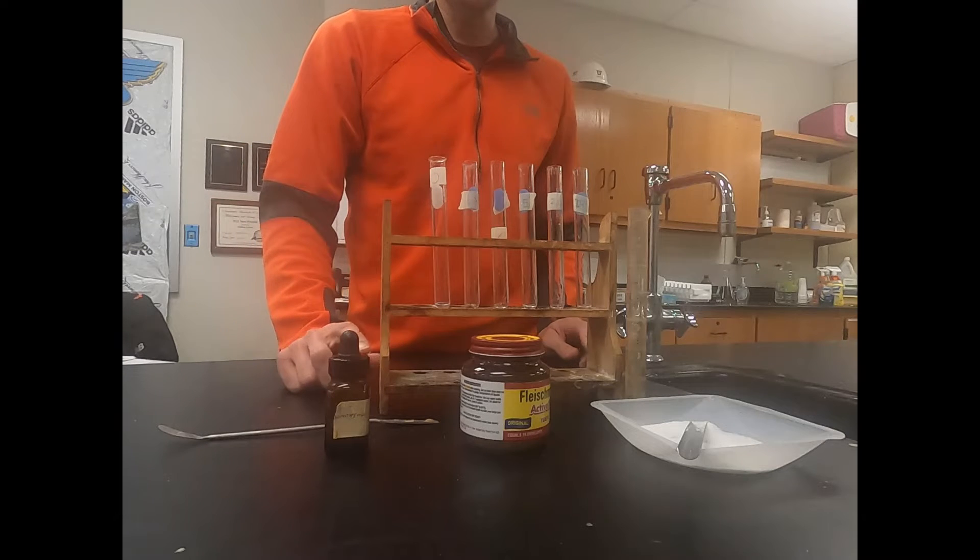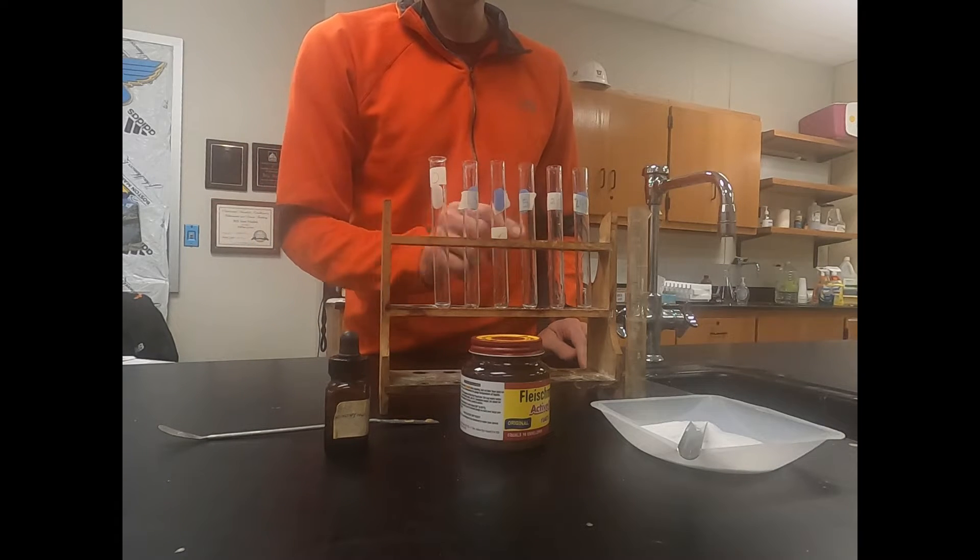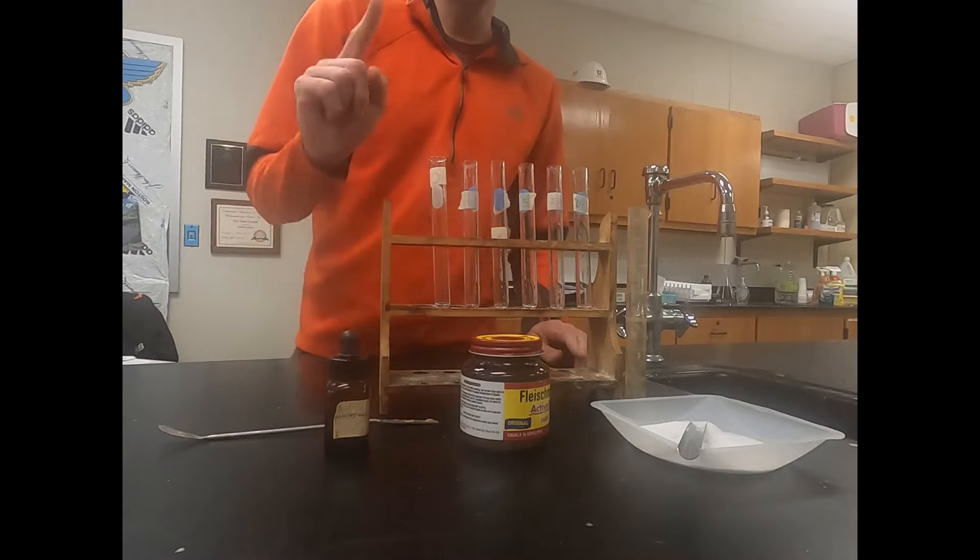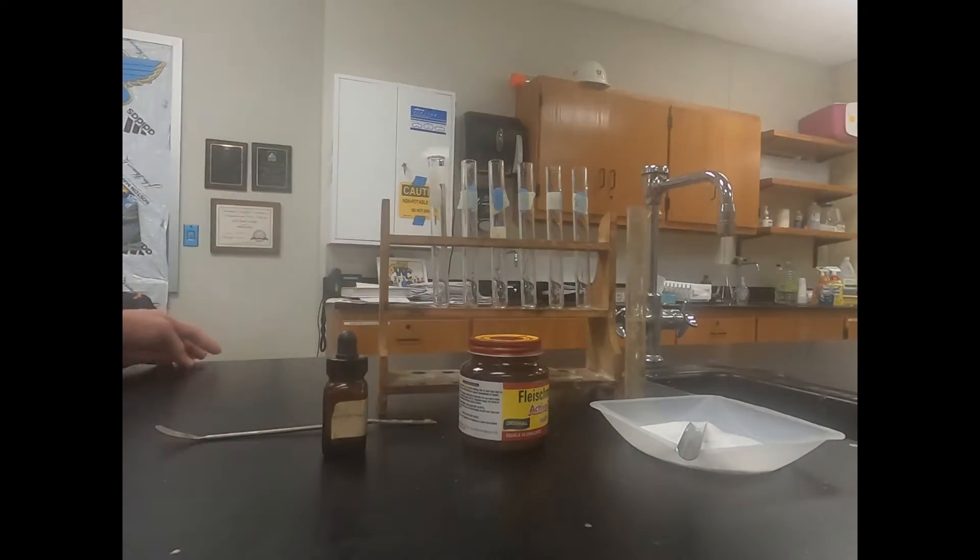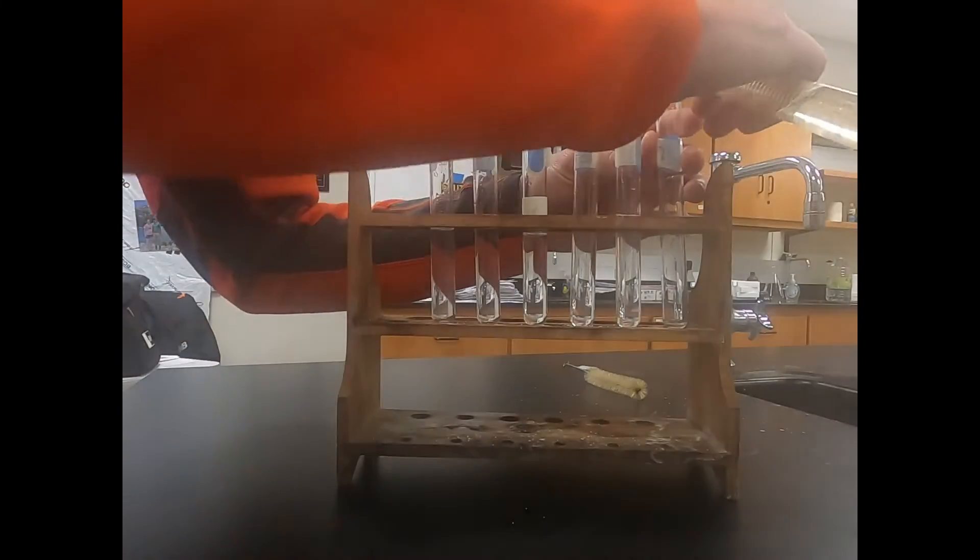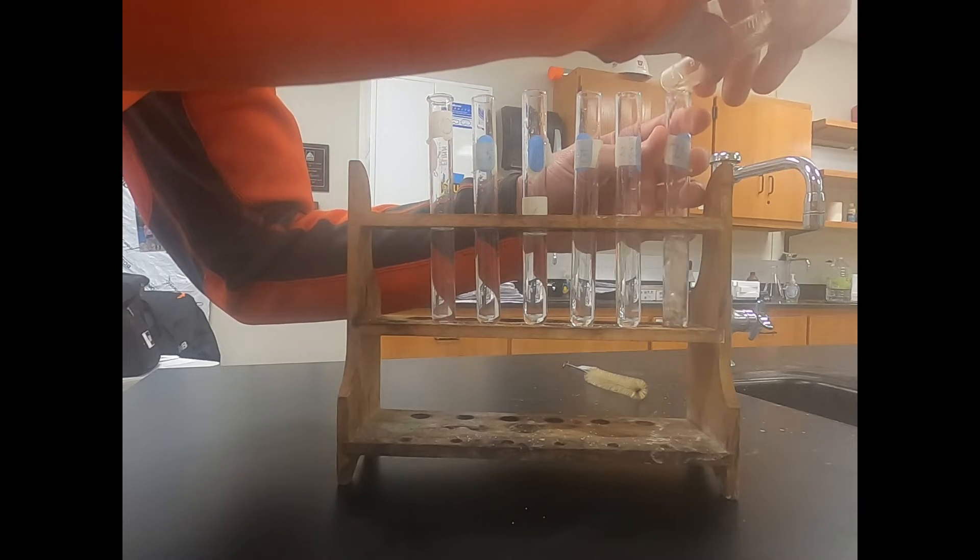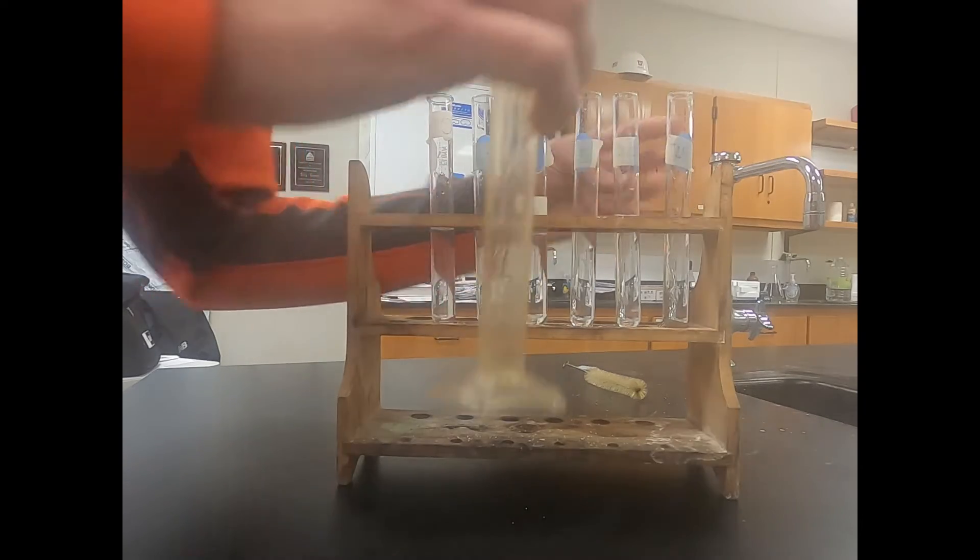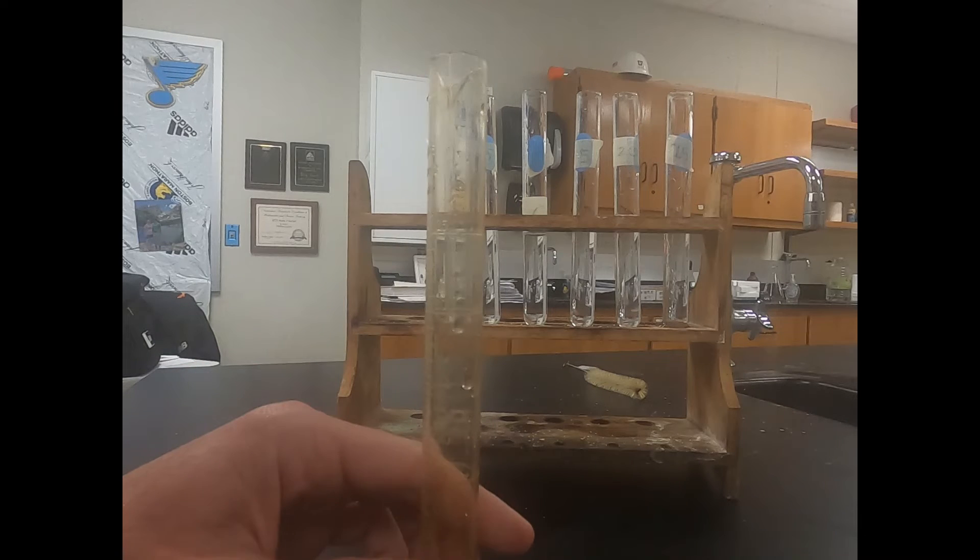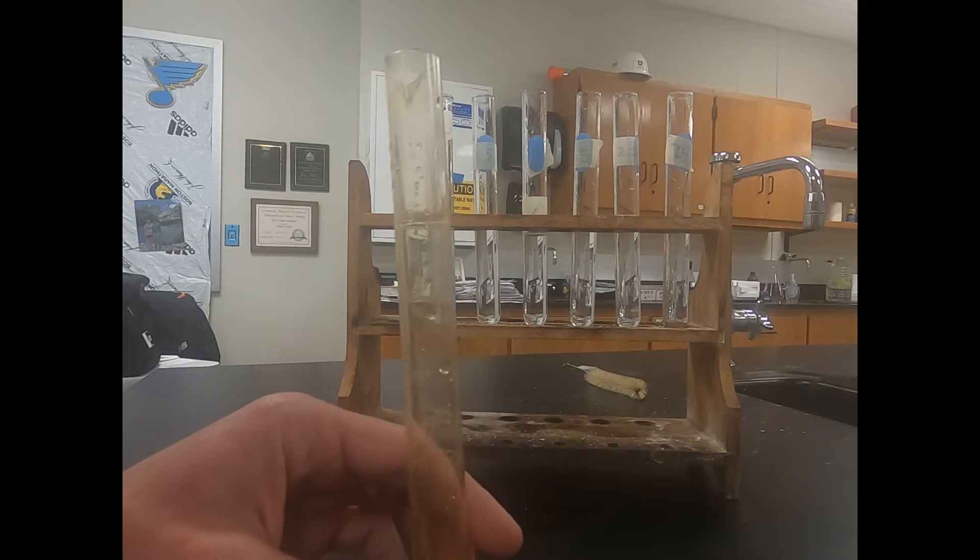We'll start getting it set up by first putting water in each one of these test tubes. So here we go.